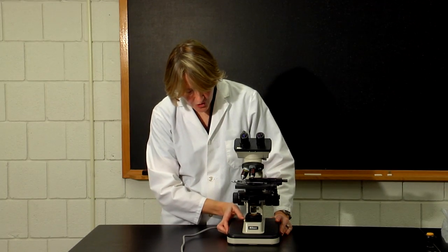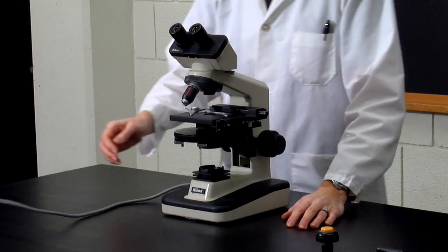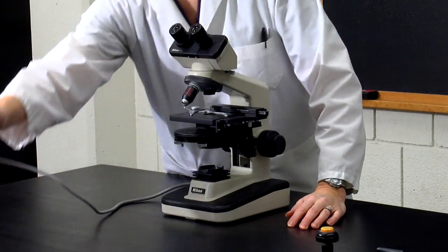You'll then want to turn off the light using the light switch dial along the side. Then unplug the microscope and carefully wrap the cord around the microscope.